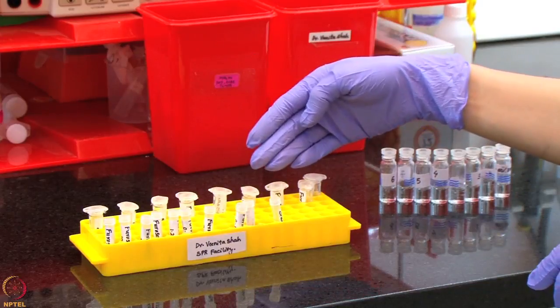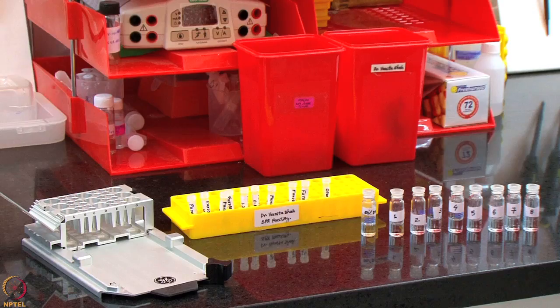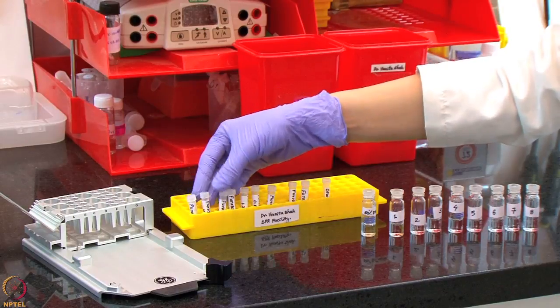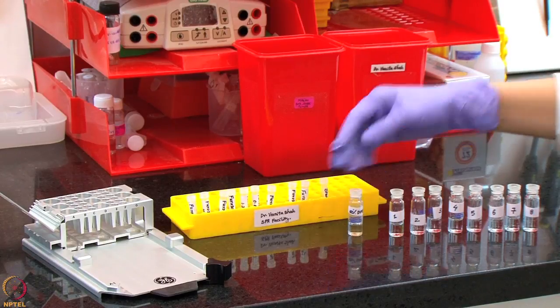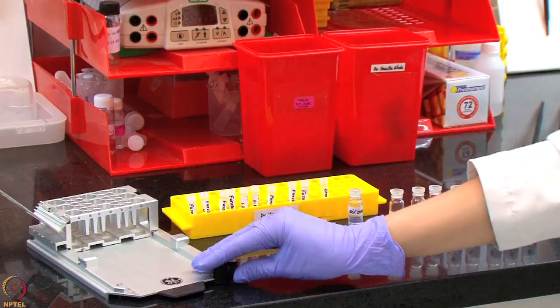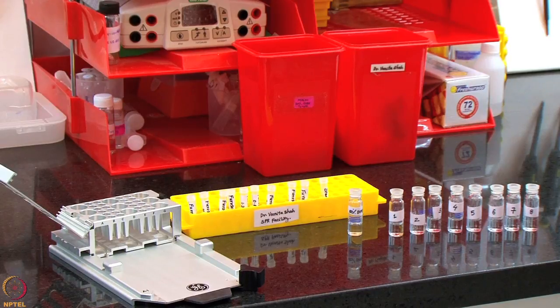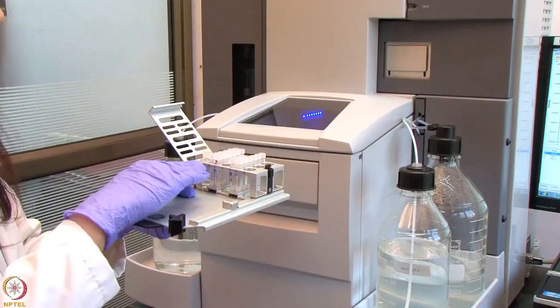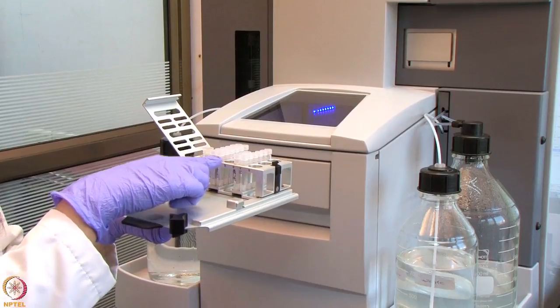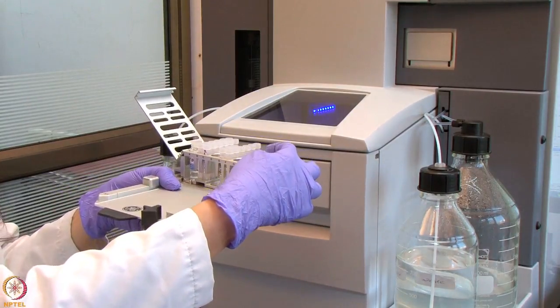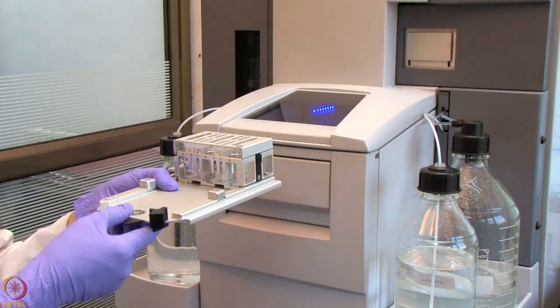All of these samples and reagents have now been aliquoted in the required volume in the specialized tube. We will now proceed to insert these tubes including the samples, the startup, 50% DMSO and the solvent correction solution into the appropriate rack and then into the system to perform the protein small molecule screening assay. We have now placed all the tubes inside the rack including the wash solution, the furosemide samples, the startup and the solvent correction solutions. And now we will place this rack inside the system to start with our kinetic assay. We will now start with our run as demonstrated in our earlier lectures.